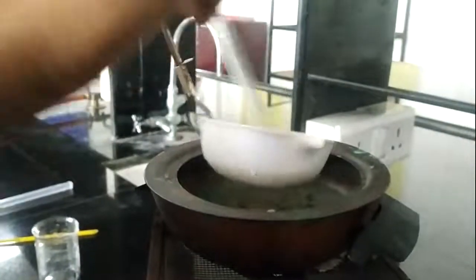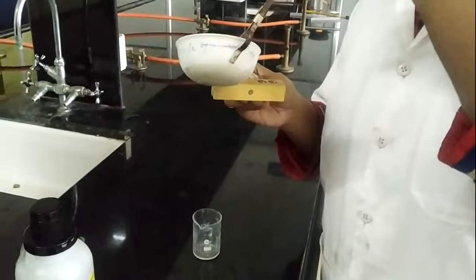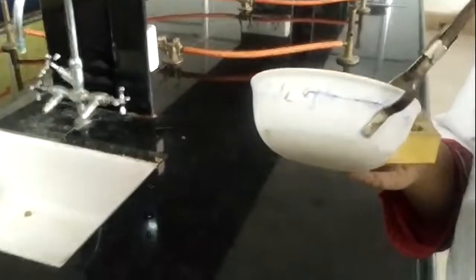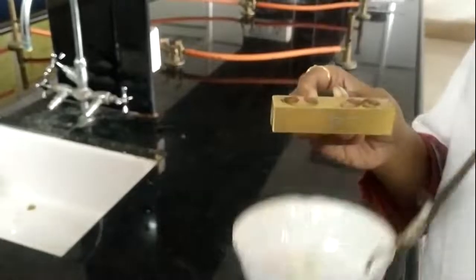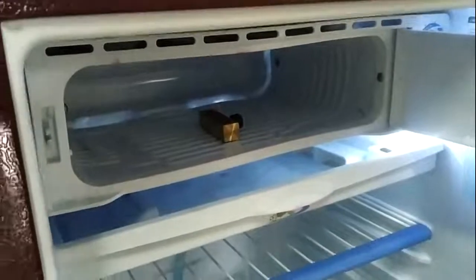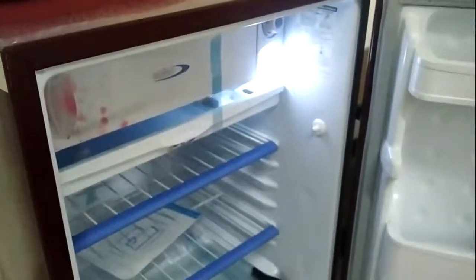After proper mixing, we will proceed to fill this into the previously lubricated mold. I am pouring the formed mixture into the previously lubricated mold, filling all 4 cavities and overfilling the mold. After overfilling, I am going to put this suppository mold into the freezer and freeze it for the next few hours until the suppositories are formed.